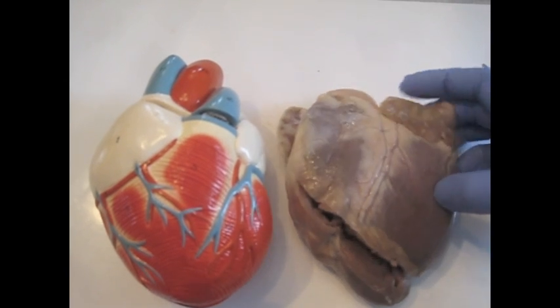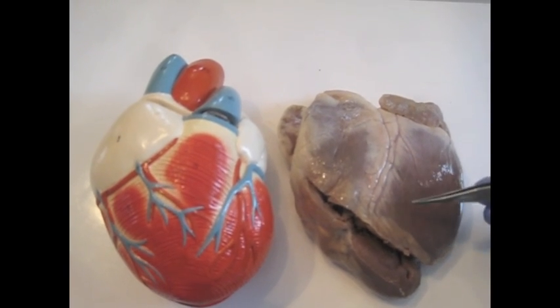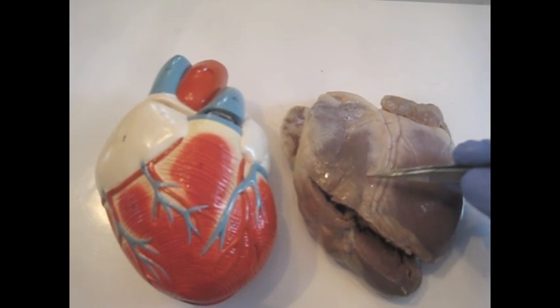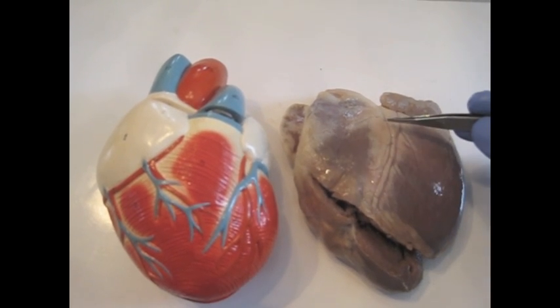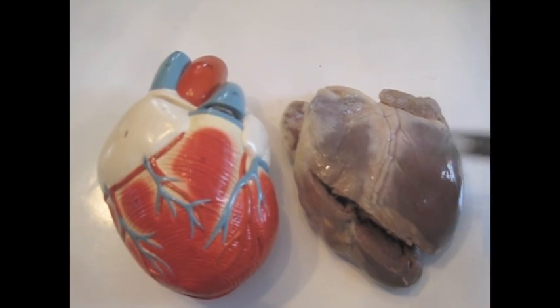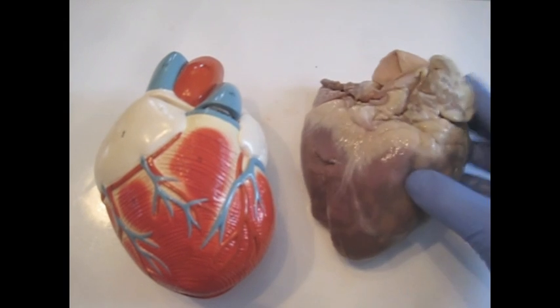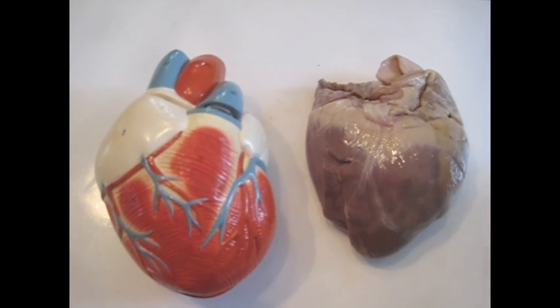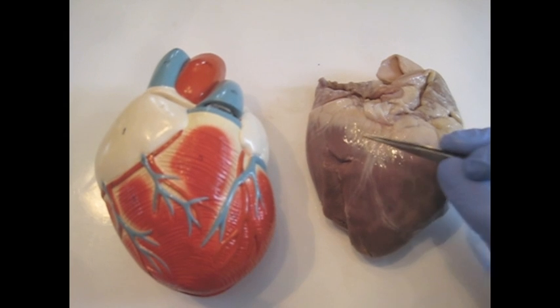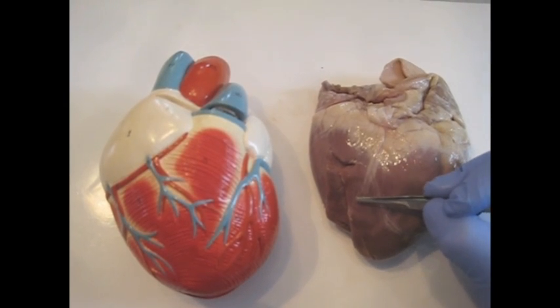There's some indication of where the ventricles lie in the heart that you can recognize even superficially. The smooth area here lies above one of the ventricles, as does this one, and in between the ventricles is an interventricular sulcus. On the other side of the heart, you can see the smooth regions here and here, which lie above ventricles, and in between is an interventricular sulcus.